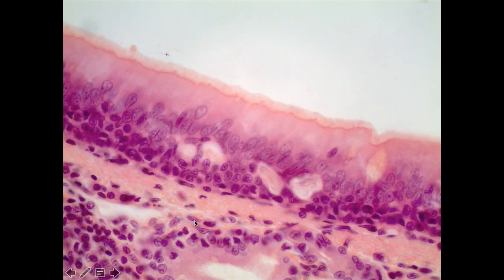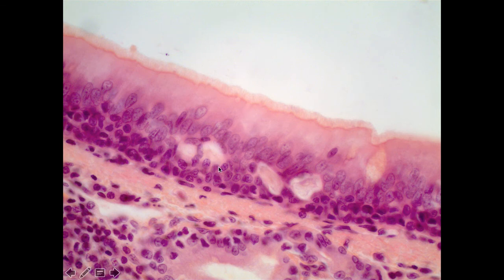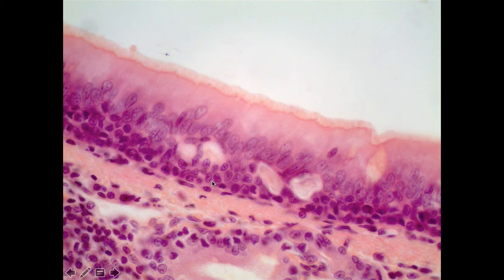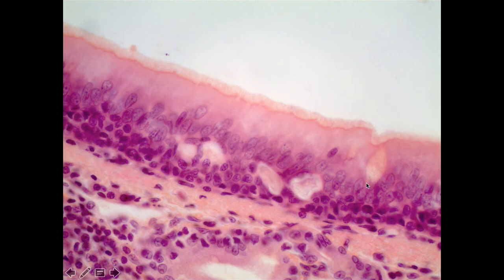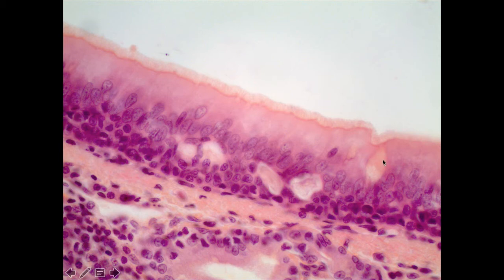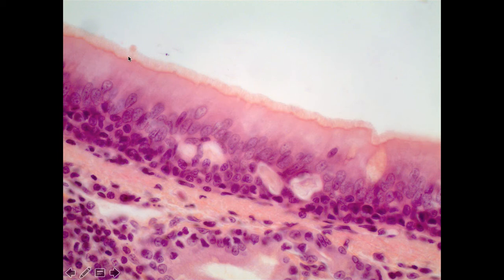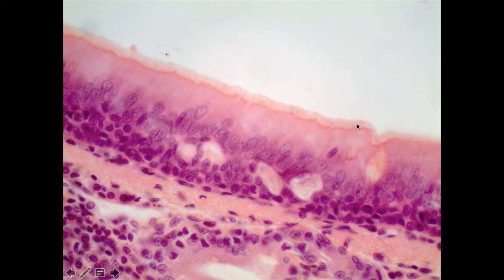If we look closely at the mucosa, we can see the very classic pseudo-stratified ciliated columnar epithelial tissue. That's common throughout the upper respiratory tract. We also can see the presence of goblet cells. The goblet cells here are producing the mucus, and we have the cilia that line this upper respiratory tract — in this case, the trachea — which is going to help move that mucus.